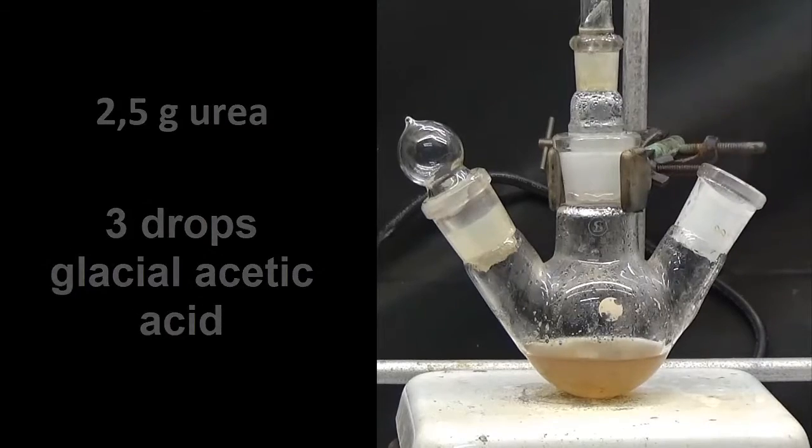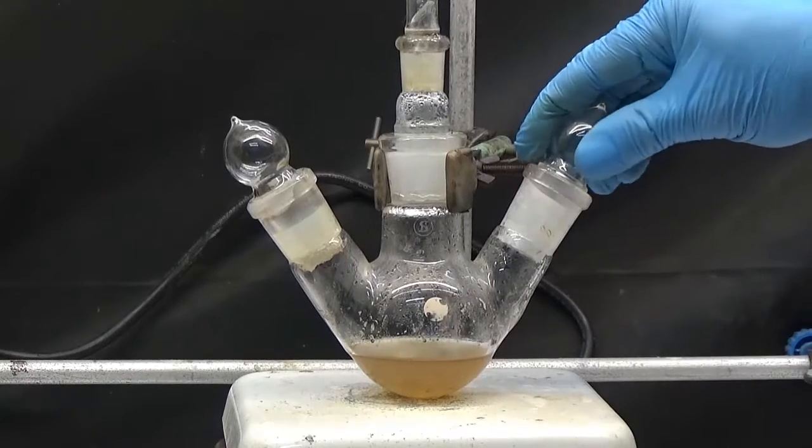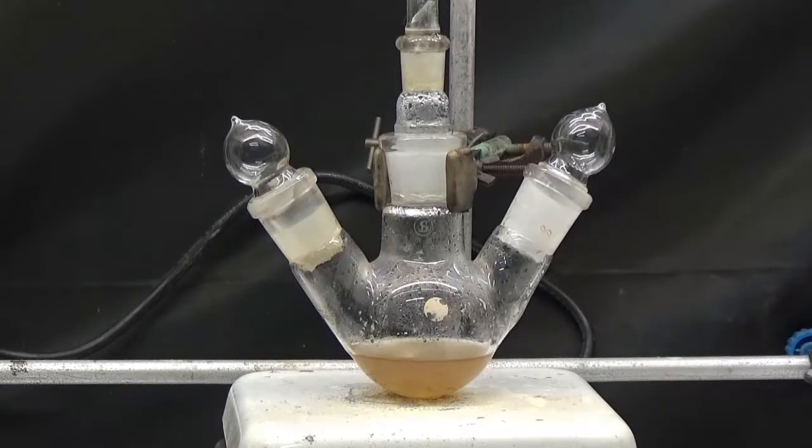Heat in reflux over an hour. It is left to cool and a white mass of dulcin emerges.